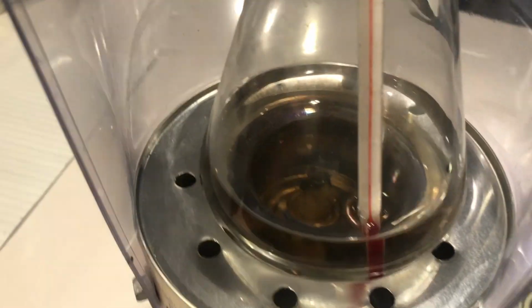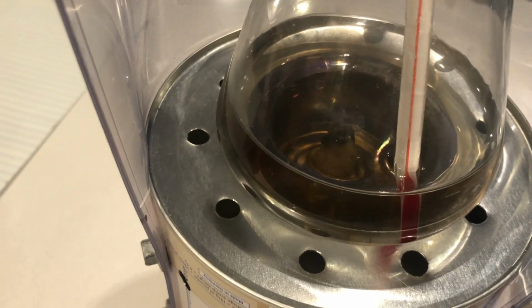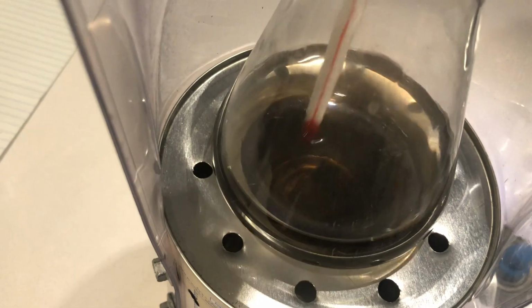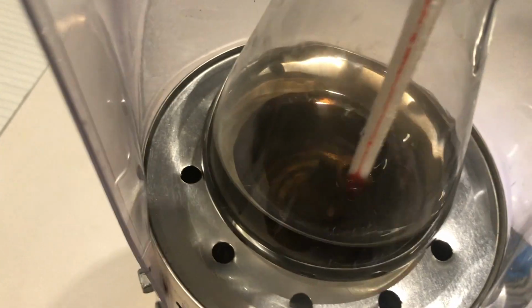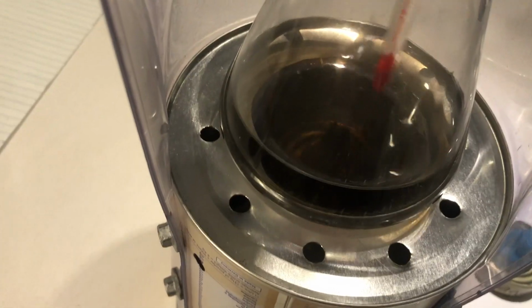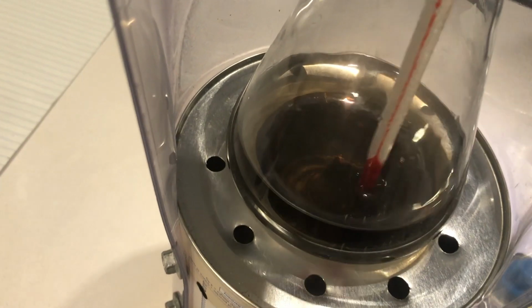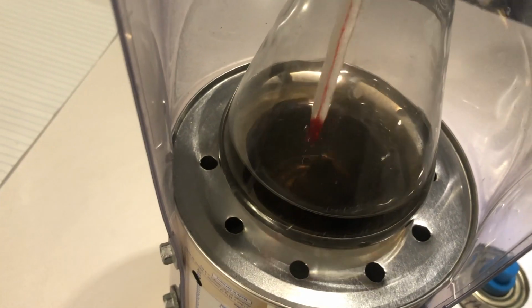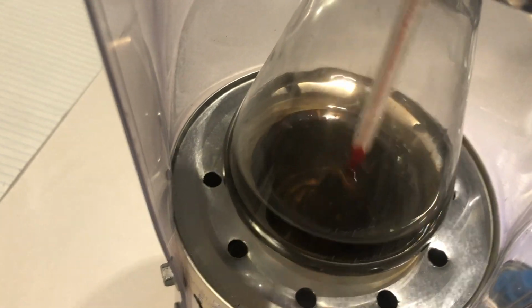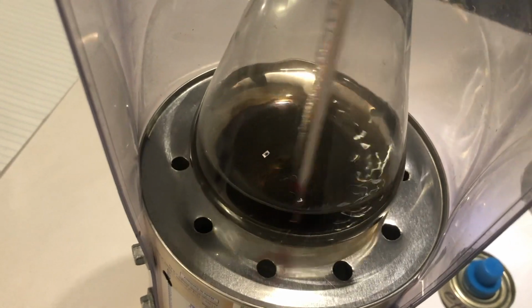And generally when you test the bigger alcohols, because there are more carbons, it requires a higher stoichiometric amount of oxygen, the ratio of fuel. Doing these sort of experiments indoors is not recommended unless you have adequate ventilation. The fumes from these bigger alcohols, because it is incomplete combustion, can be a bit toxic, as it is releasing carbon monoxide and soot and unburnt fuel as byproducts, perhaps slightly decomposed fuel.